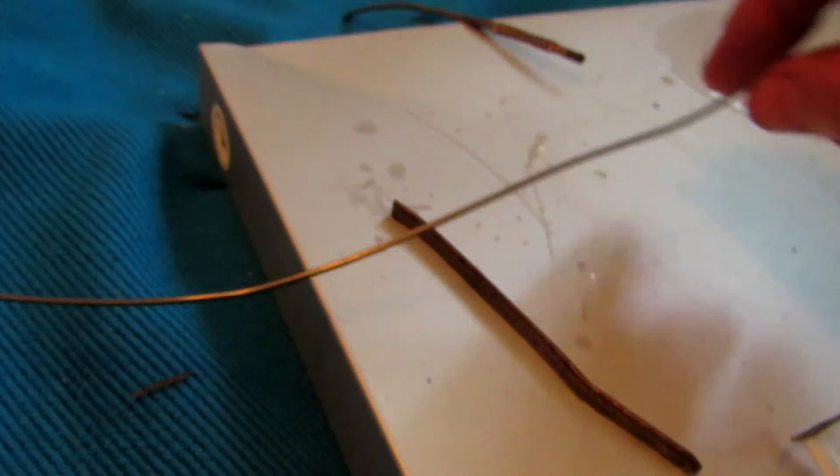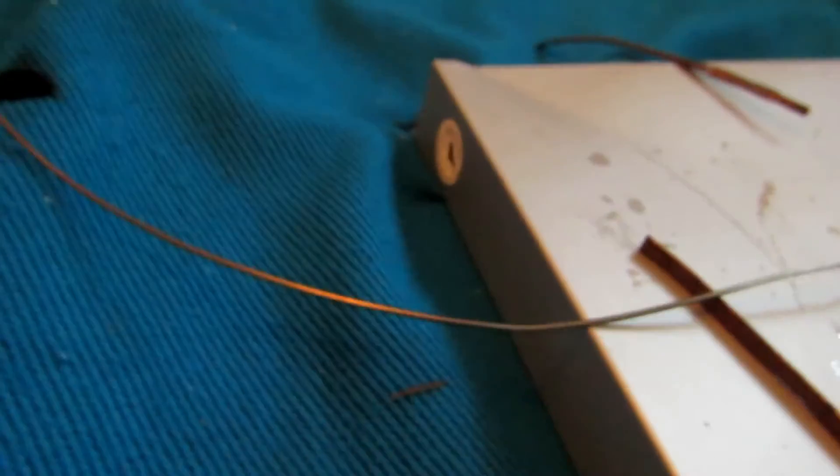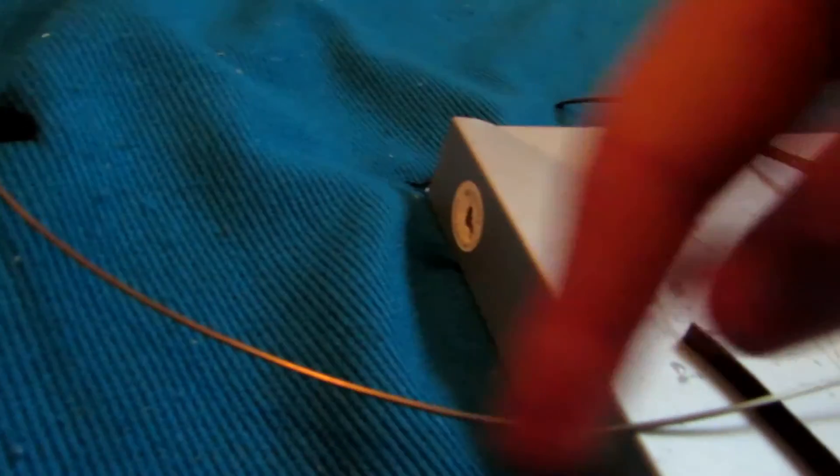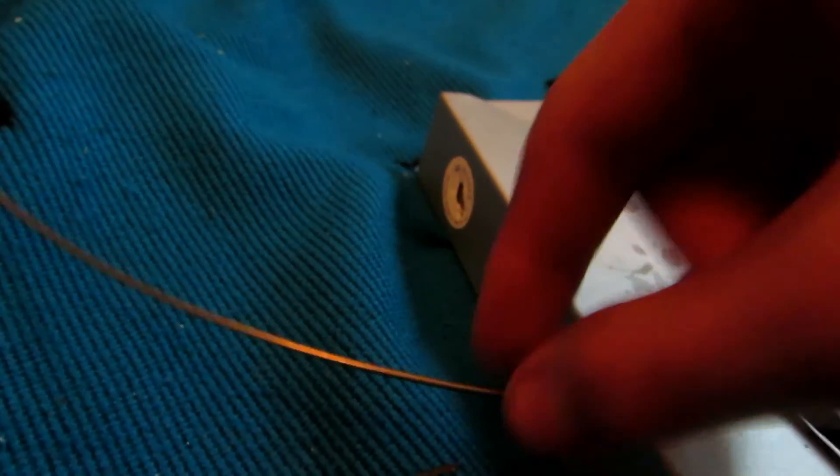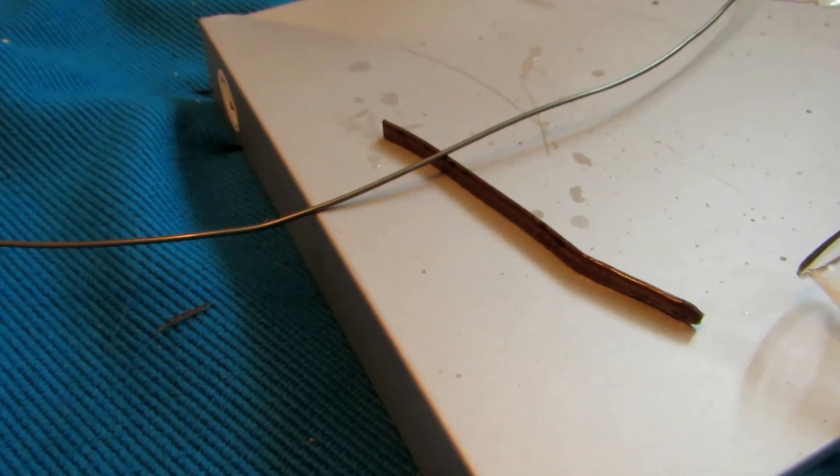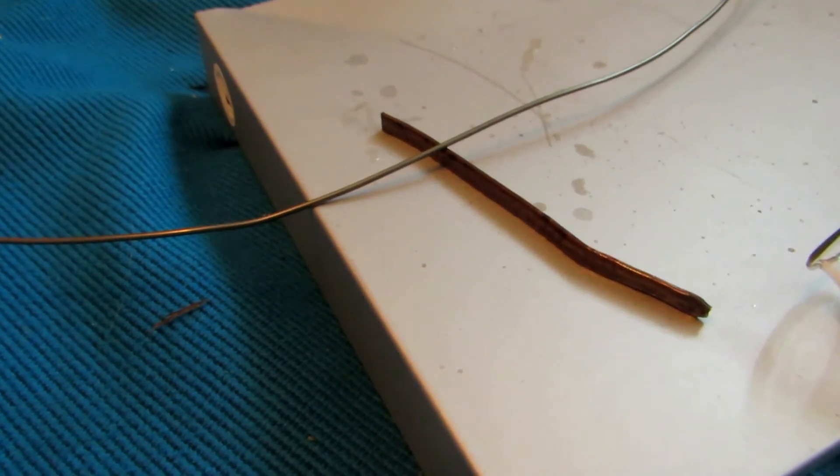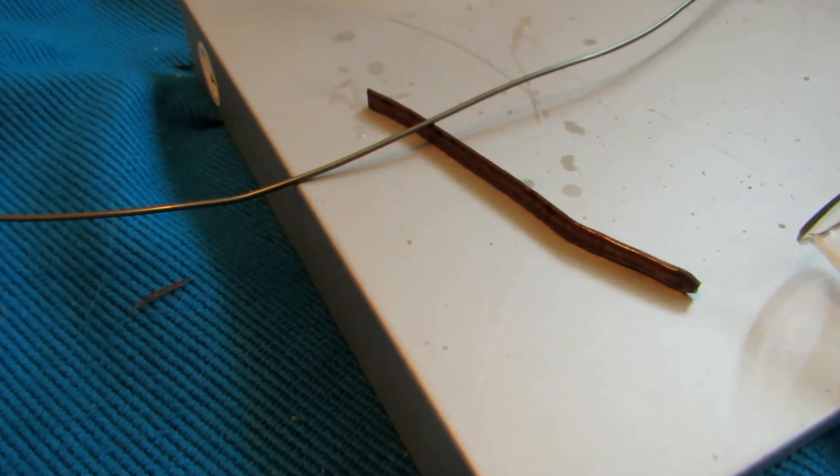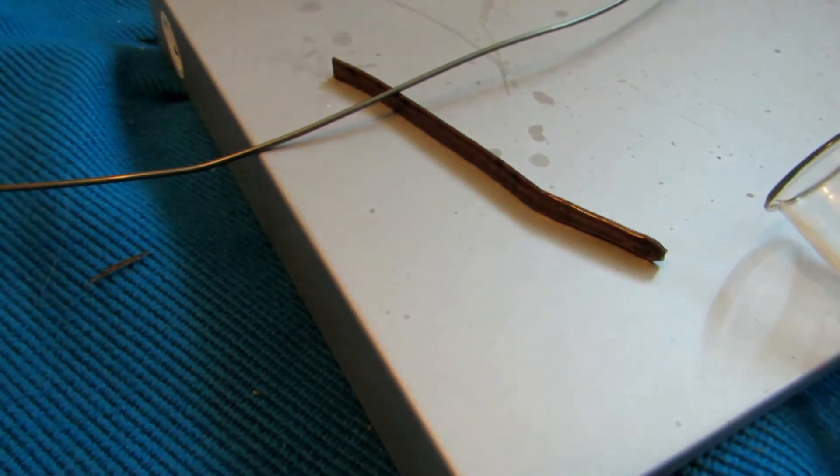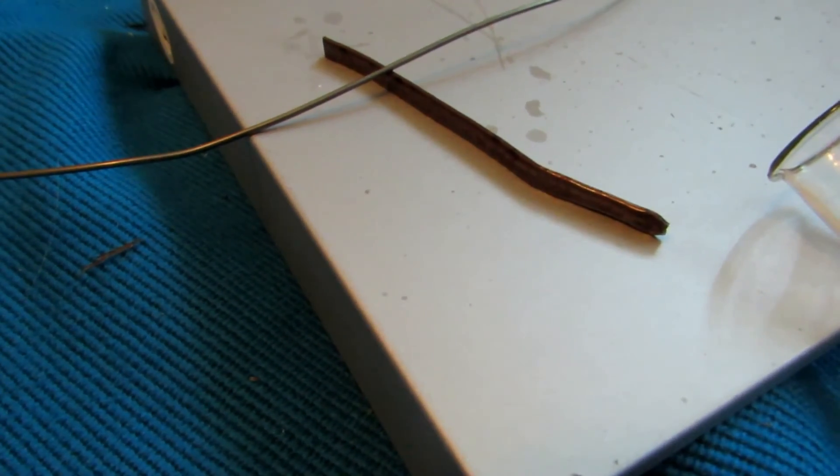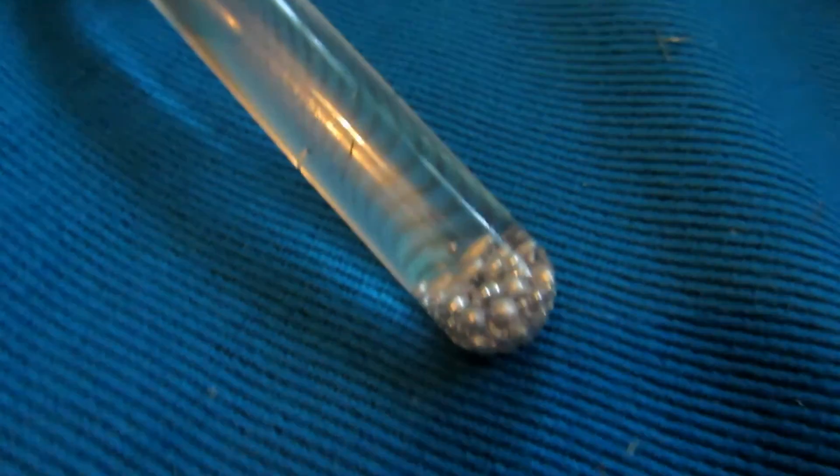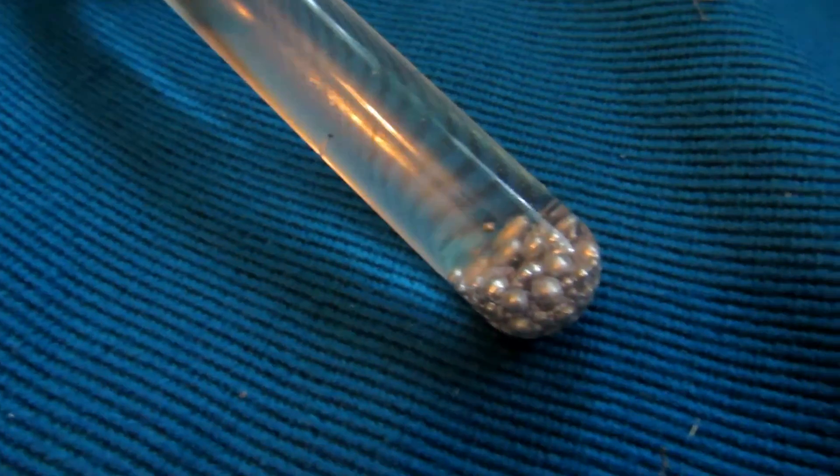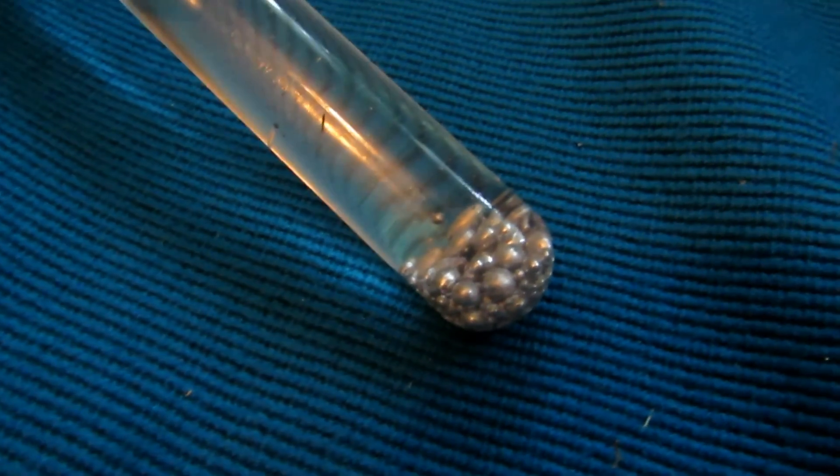And as for this longer one over here, save this one also because it has a bunch of sodium and potassium alloy inside of here, although it is significantly less. Now in that final thing that I did take out from the knob, there was a little container which probably contained a whole lot of sodium and potassium alloy. But the only way to open it would have been to saw it, which would have probably ignited it, and that just would have ended badly. Now so that is basically how to get sodium and potassium alloy from an oven.